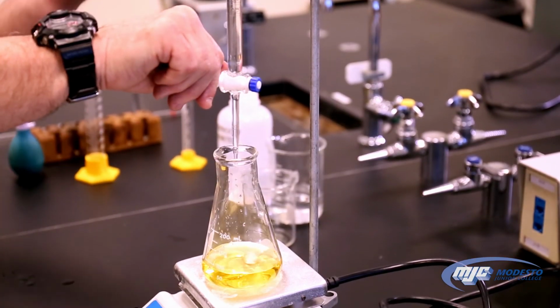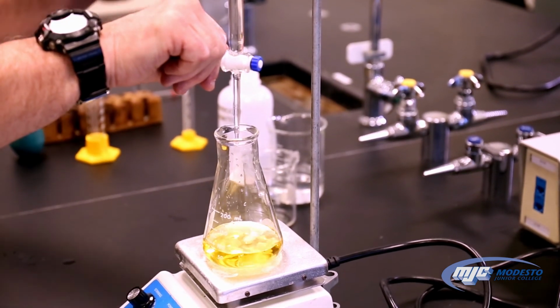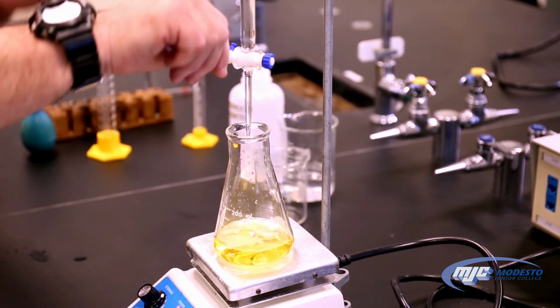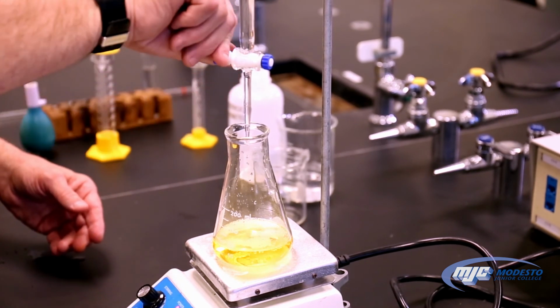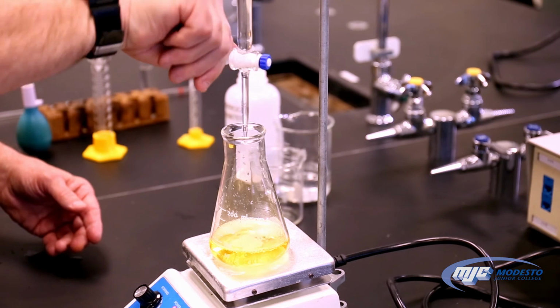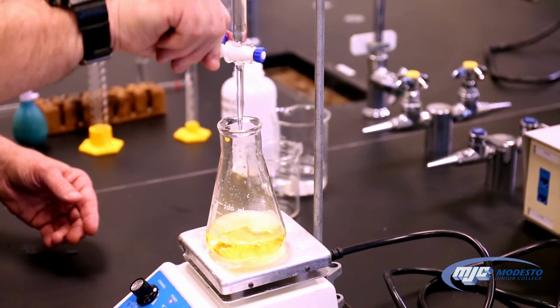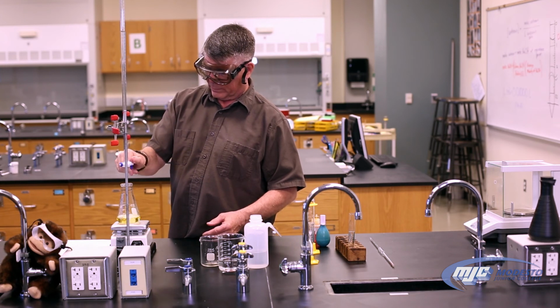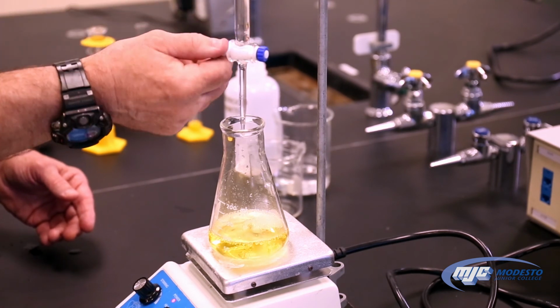So just as before, I can turn the stopcock kind of slowly at first until I start seeing splashes of color. Then I'm going to slow down by twisting faster. Starting to see a little splash of color. So I'm going to go a little bit slower by twisting a little bit faster.